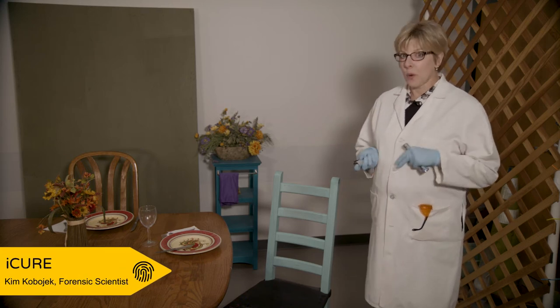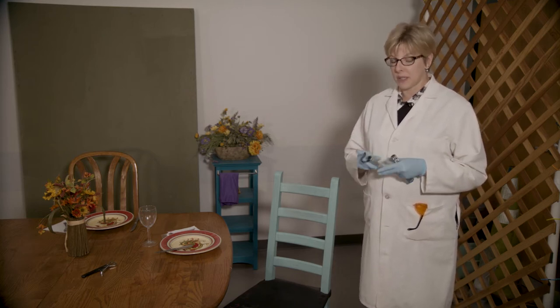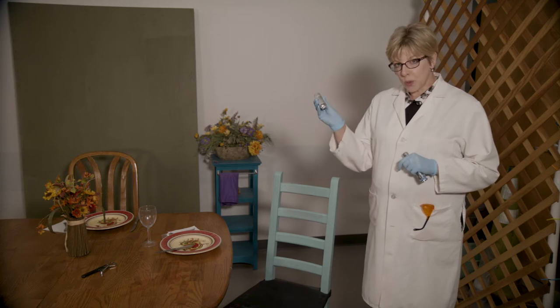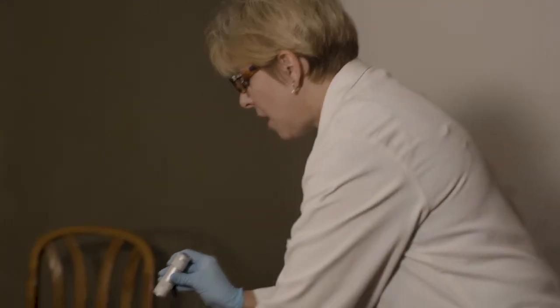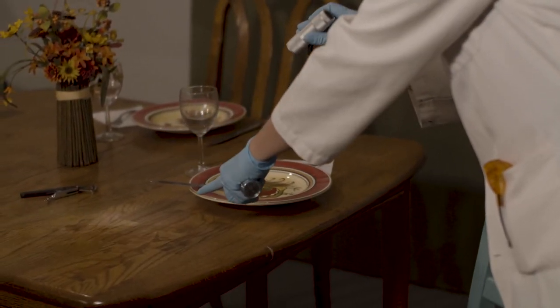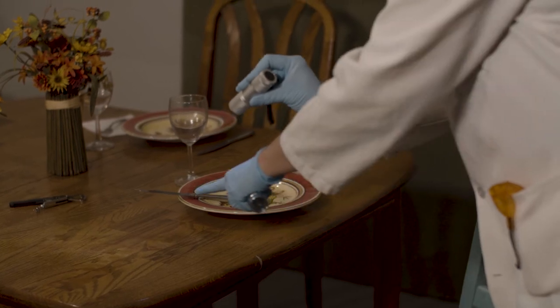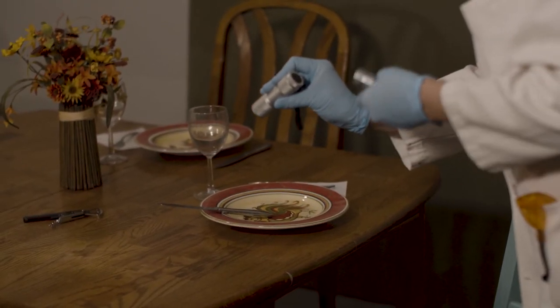Hi, so we are back at the crime scene and I want to introduce you to another common tool that is used both in the laboratory as well as at the crime scene — used to identify and then help collect evidence. We used a flashlight earlier to visualize this swipe of red-brown staining on the table, using it at an oblique angle to better visualize this potential bloodstain.